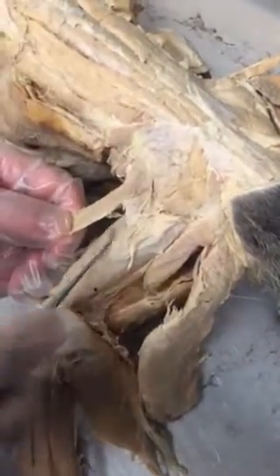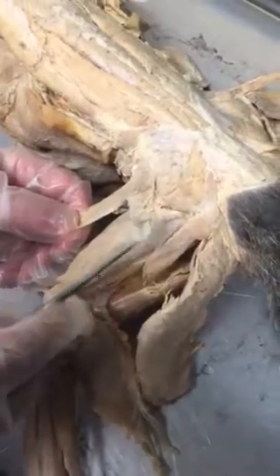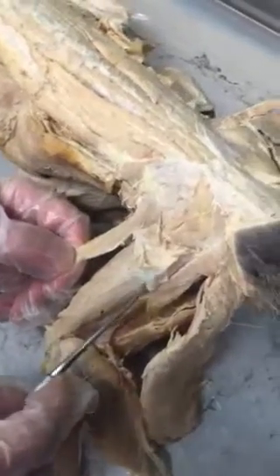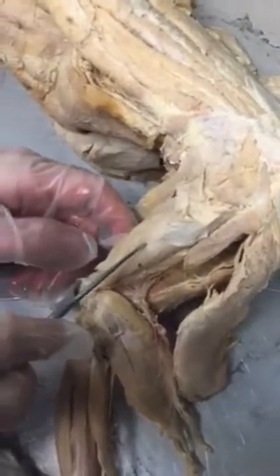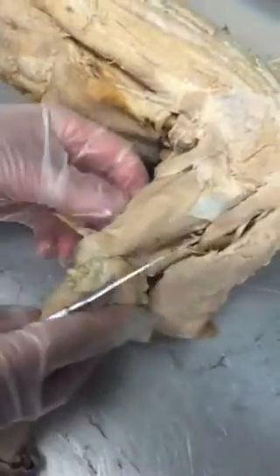Caudal means tail. Then on the upper part of the thigh, you remember the tensor fascia lata. Everyone always remembers that muscle. This is the fascia here. It's sort of a triangular muscle under the gluteus medius. Well, this is the fascia actually, but the muscle, all of this, is the tensor fascia lata. This again is the vastus lateralis. You're seeing it from the side view. You could also see it from this view with the rectus femoris.